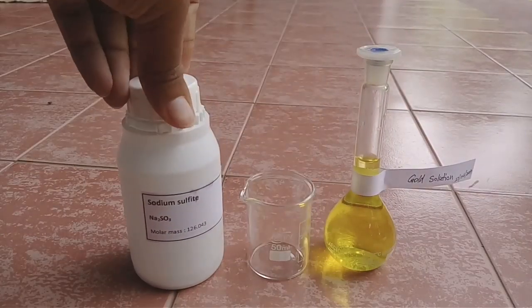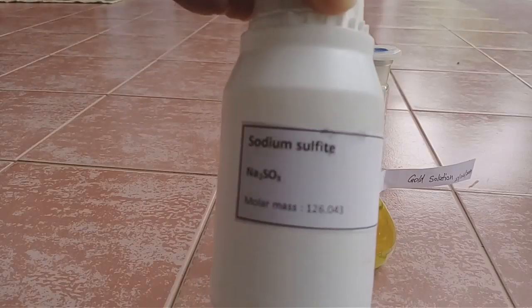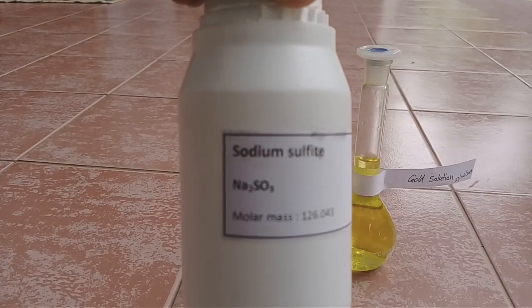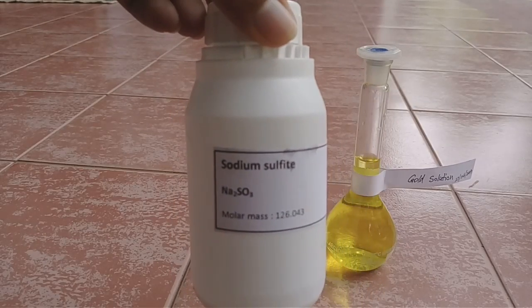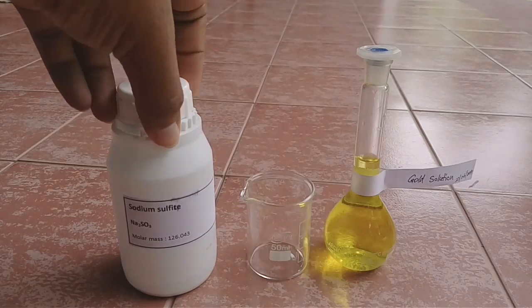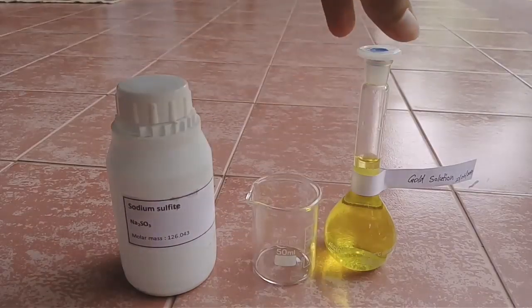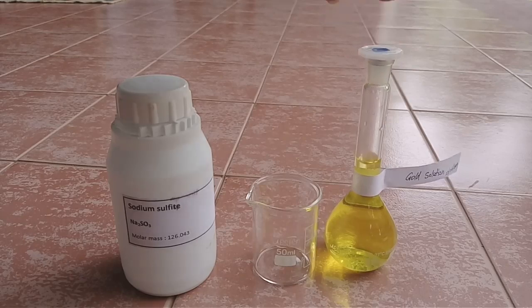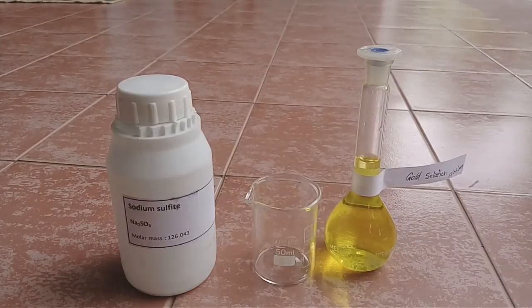So we need sodium sulfite. Now you can see here sodium sulfite. First I am going to add some gold solution to this beaker.